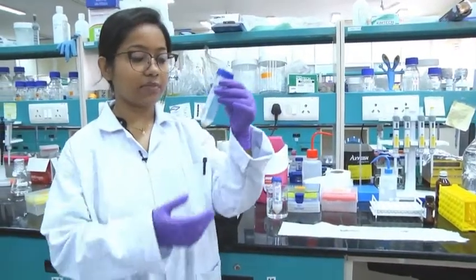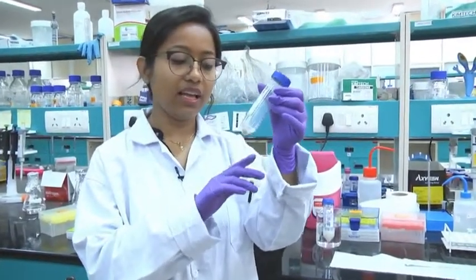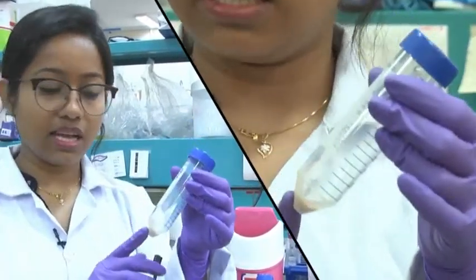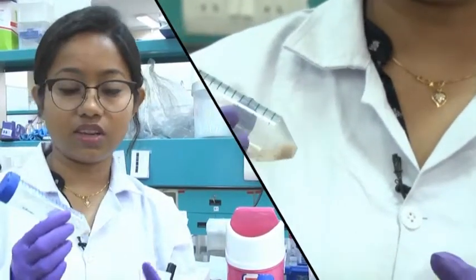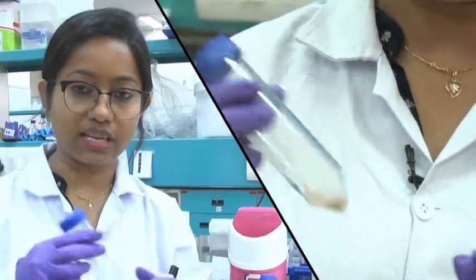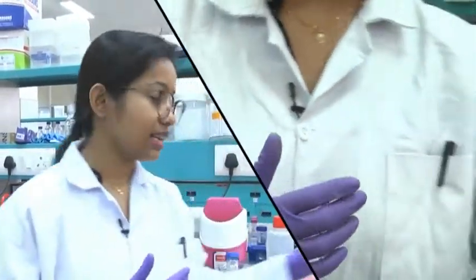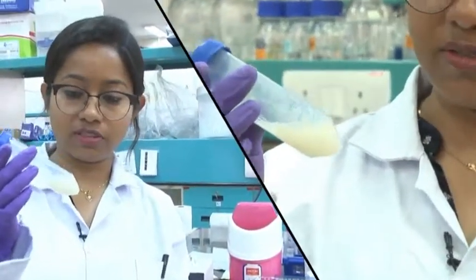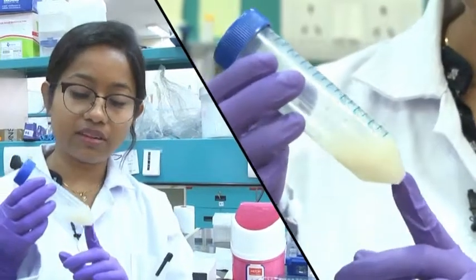After the induction process, we need to collect the cell pellet. We do a centrifugation process to get the cell pellet and discard the media supernatant. When you collect the cell pellet, it will be at the bottom of the tube. You can keep the cell pellet at minus 20 or minus 80 degrees, and whenever you want to purify the protein you can do so. Alternatively, you can resuspend the cell pellet in a lysis buffer — here I have resuspended it from around 1 liter of culture.